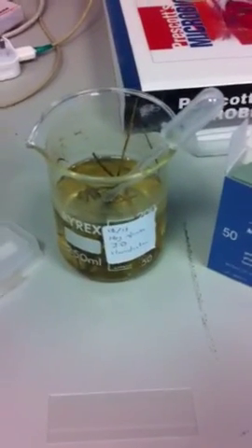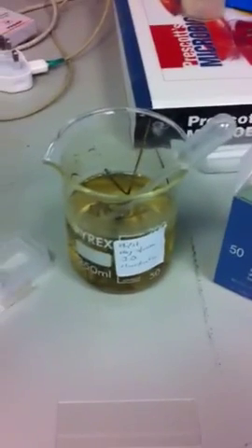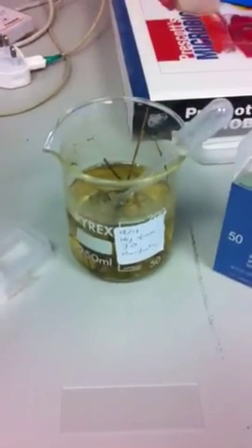And for the sampling we're going to be using a hay infusion I've made. This is pond water and you put some hay in it to give some energy to the organisms.